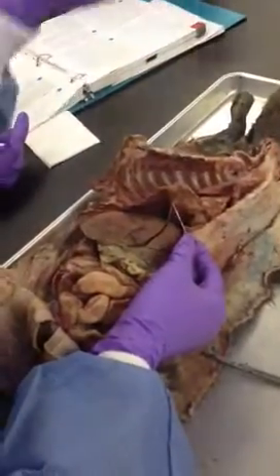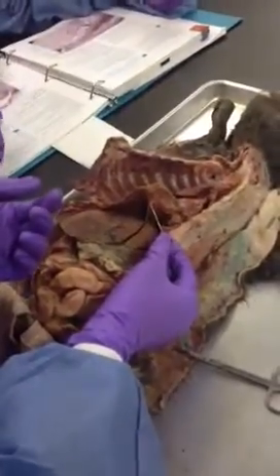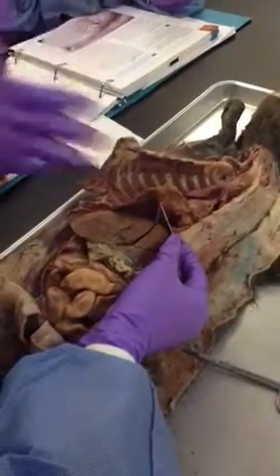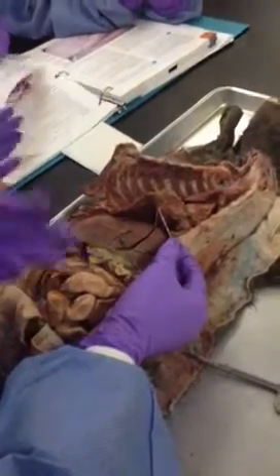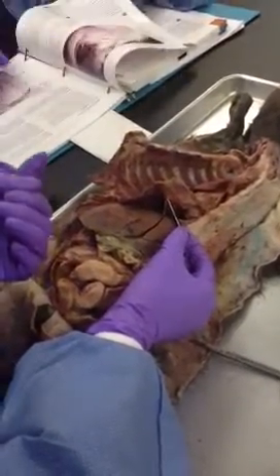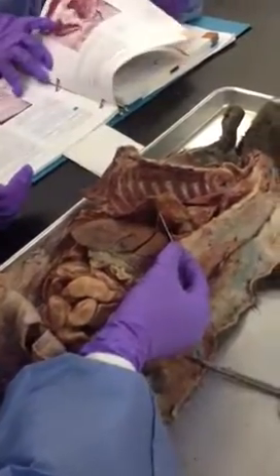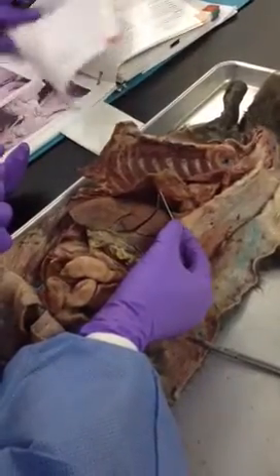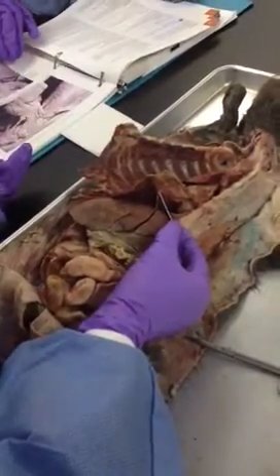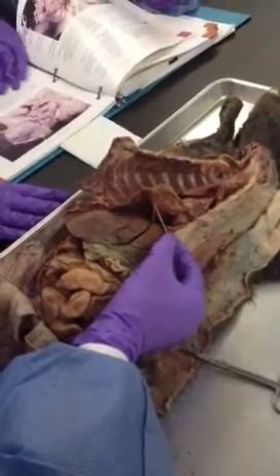Obliterated means it's the remnant of the umbilical vein. All right? It's the closing of the umbilical vein, because that's from fetal circulation. We don't want that to stay open when we mature. The round ligament of the liver, and I'm going to make sure to say round ligament of the liver, that's the full name of it, is the obliterated umbilical vein.